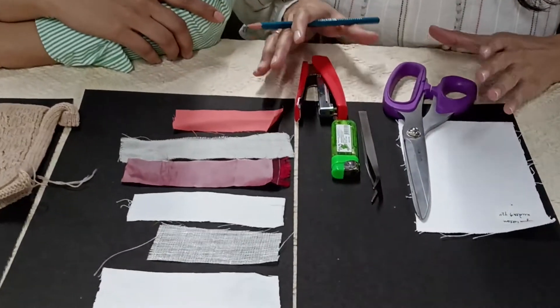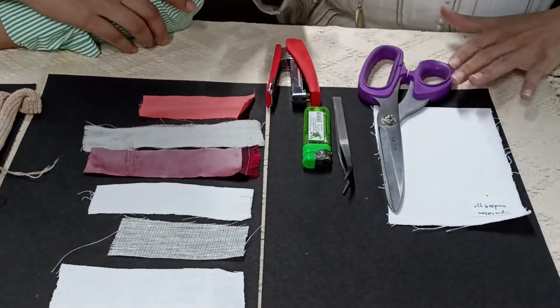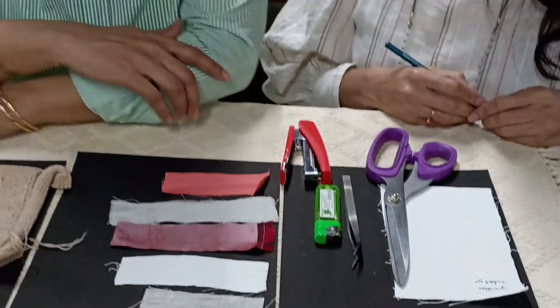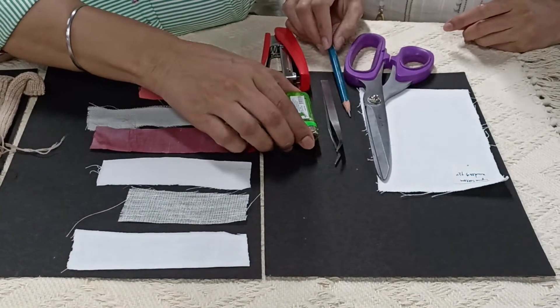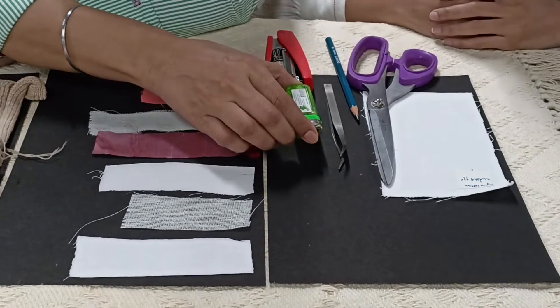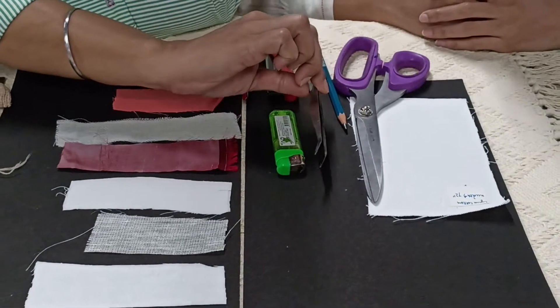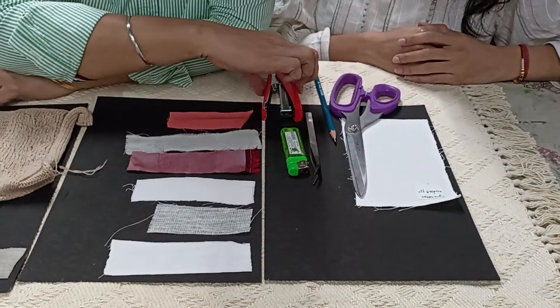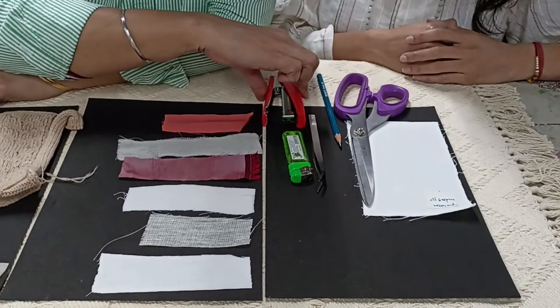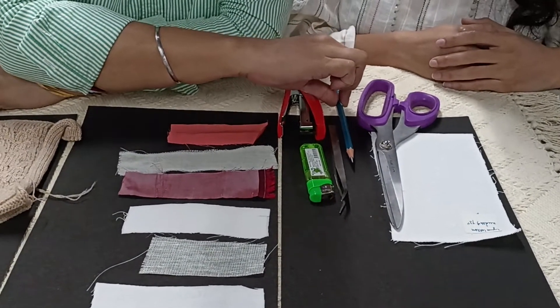Let's now come to the burning test. The tools required for the burning test are: you require a lighter, or if you don't have a lighter then you can use a matchbox. You require a forcep, a scissor for cutting the fabric, a stapler for stapling the fabrics after doing the burning test, and a pencil for doing the observations.